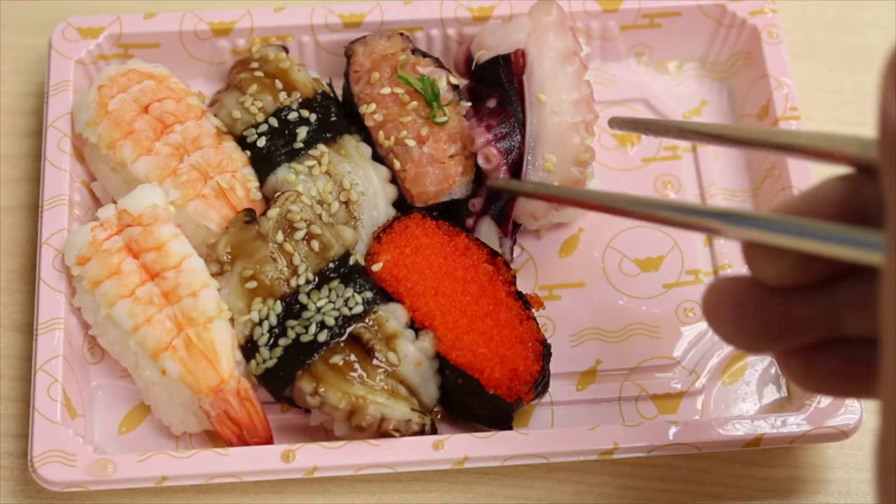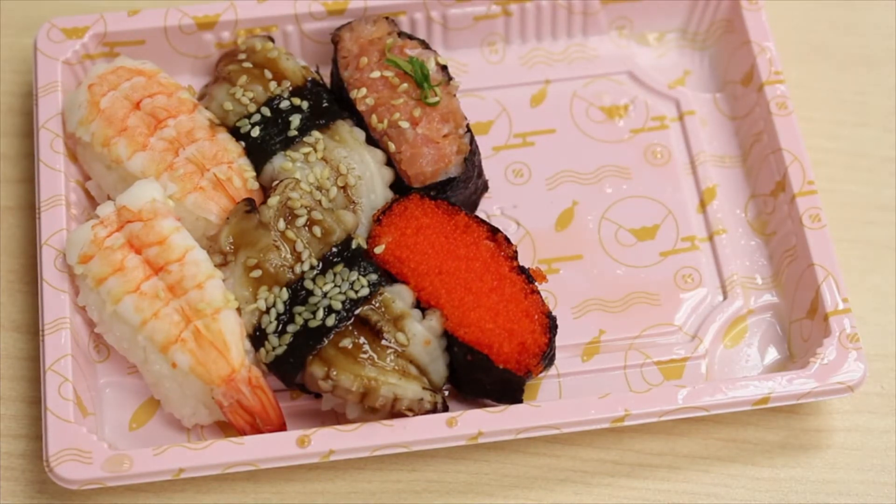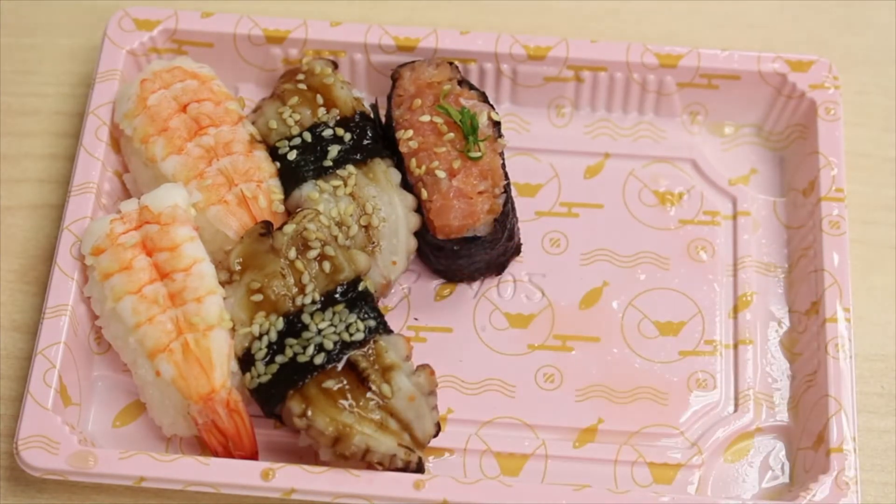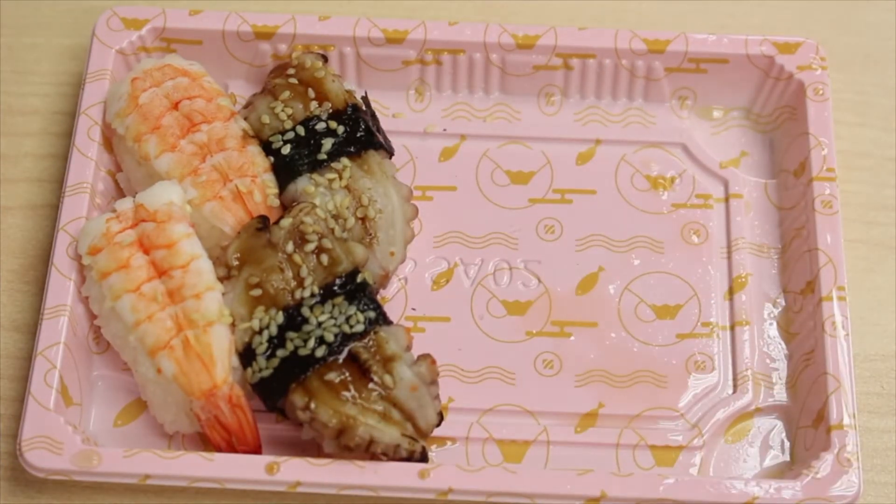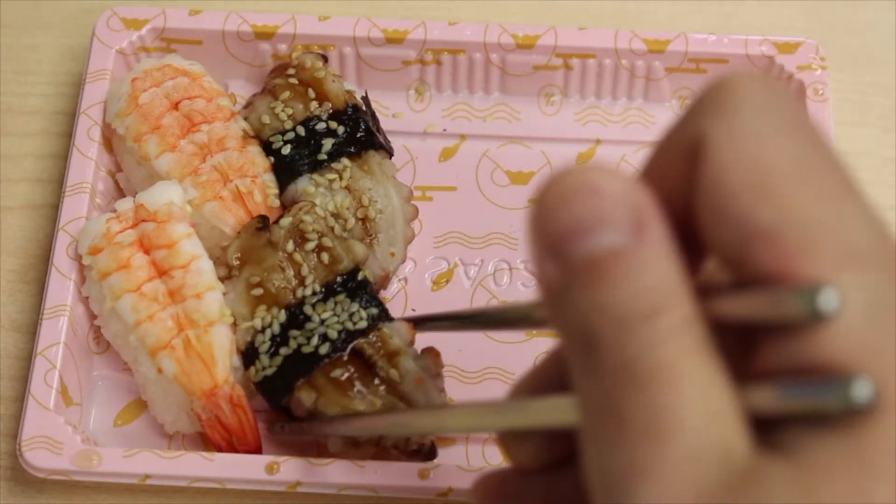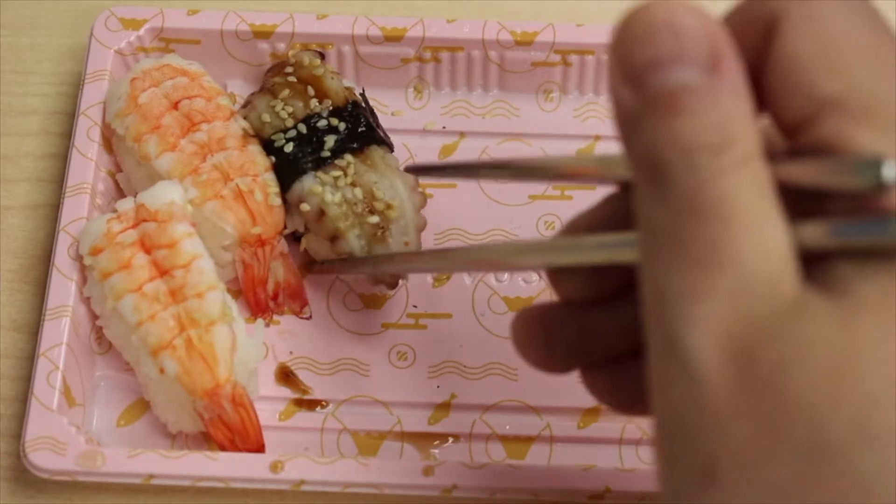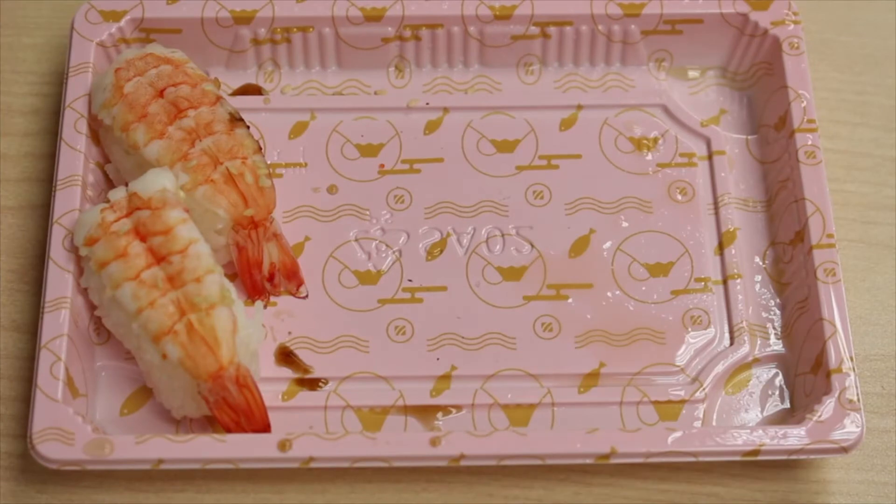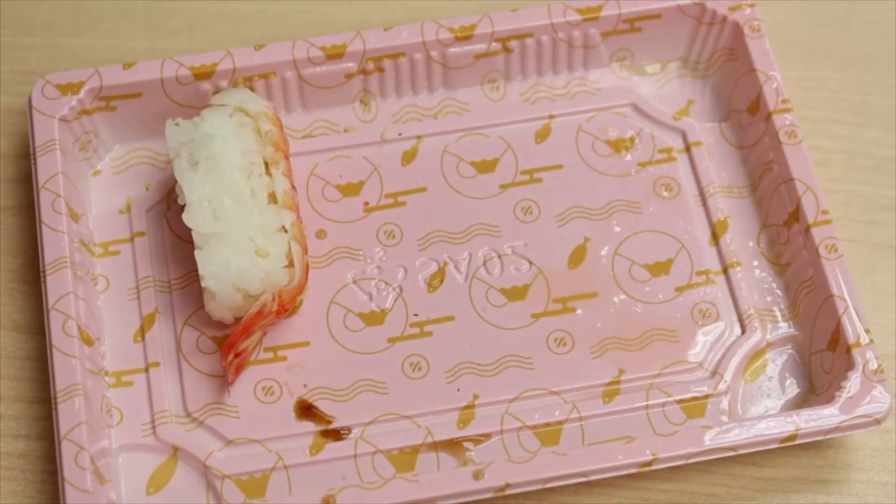And I often want to ask why you even have to eat that stuff. Well, the older people always said because sashimi has safety concerns and wasabi is very spicy so it can kill germs. Well, I never thought about that answer because I simply just don't care. But right now since we have this chance, I think maybe I can do a test to see whether wasabi can really kill germs like what people say.